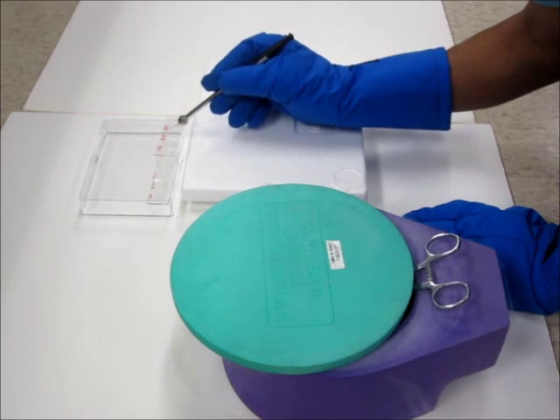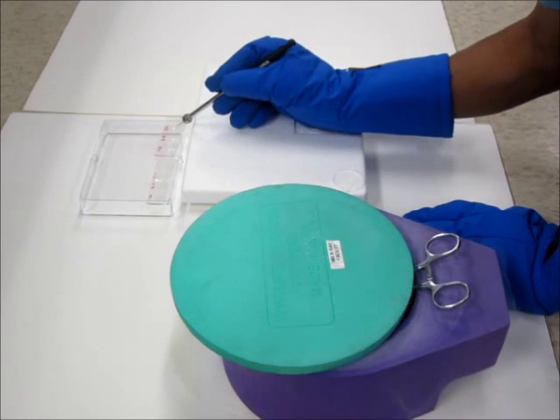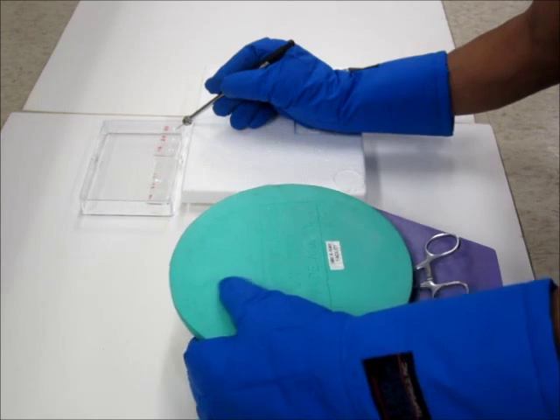Now I am moving to the second cryo buffer with a higher cryoprotection concentration. And finally moving to the third cryo buffer with the highest level of cryoprotection.